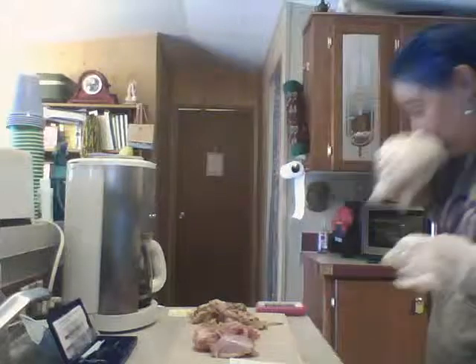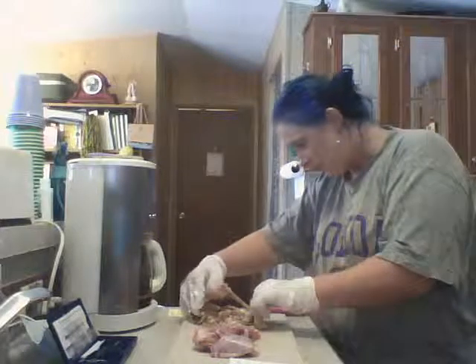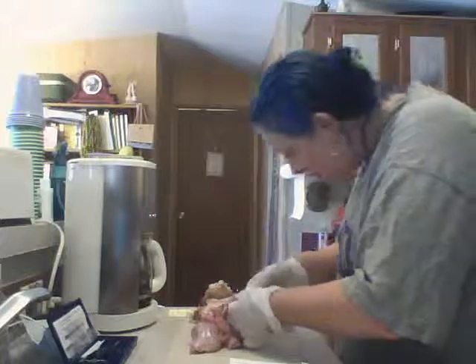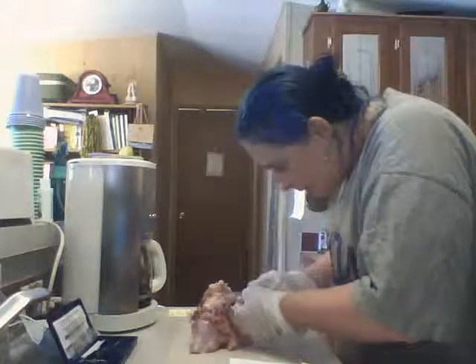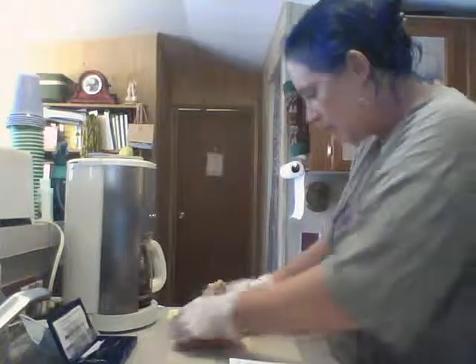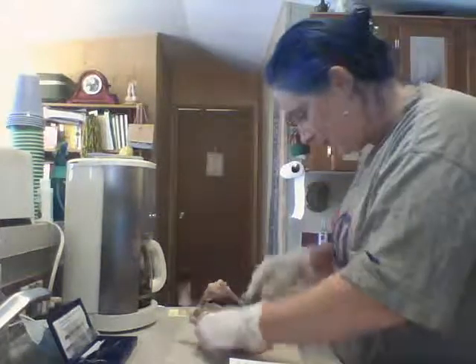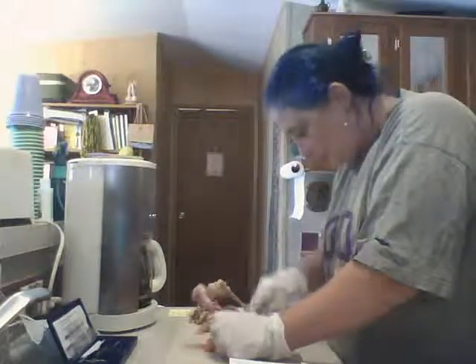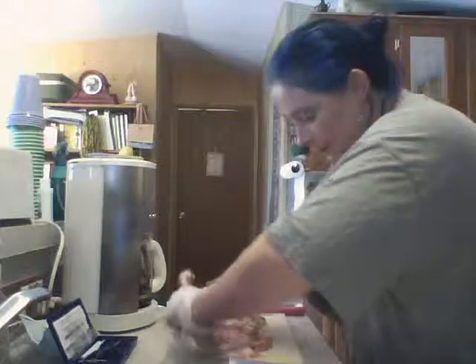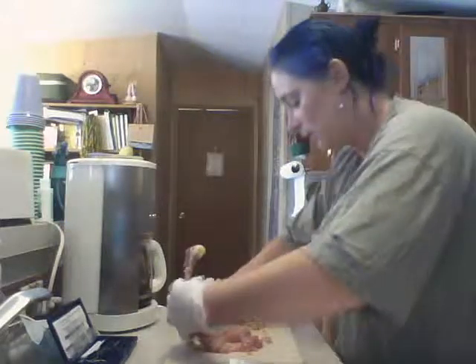Okay. There we go. All this meat away so that we can see the bones.